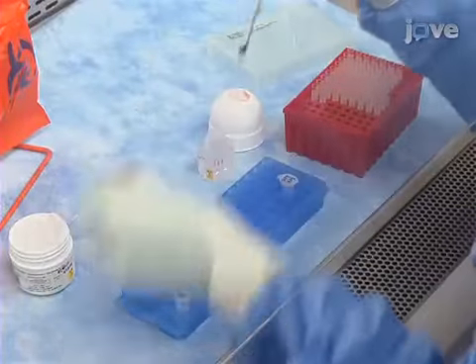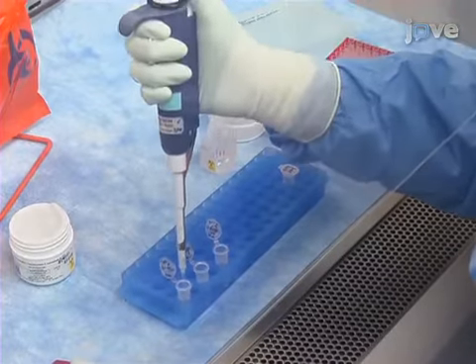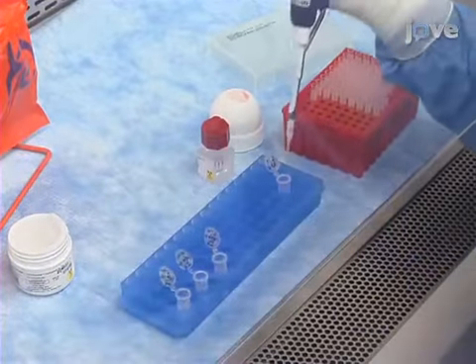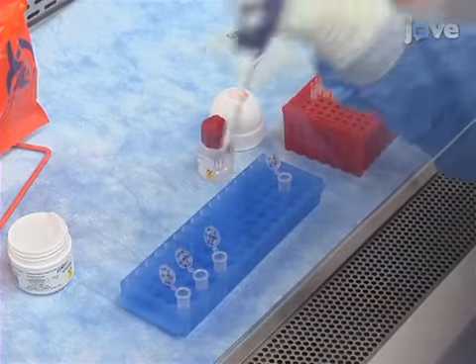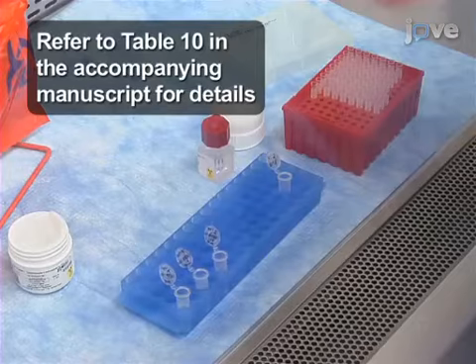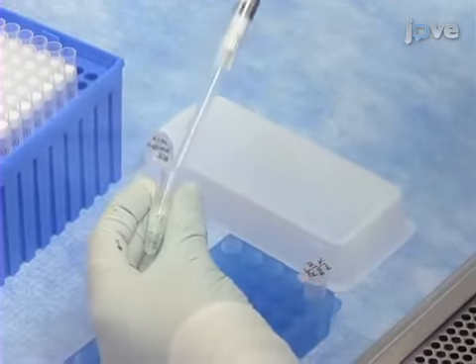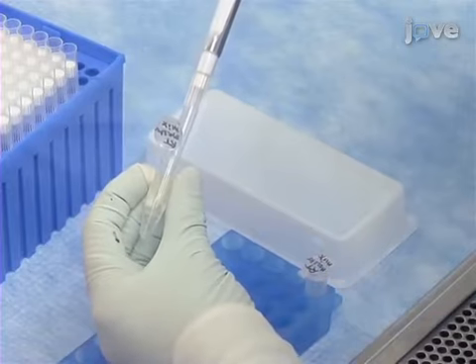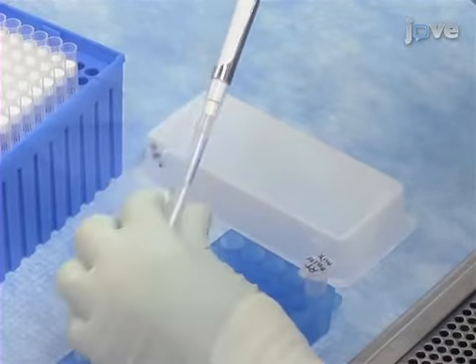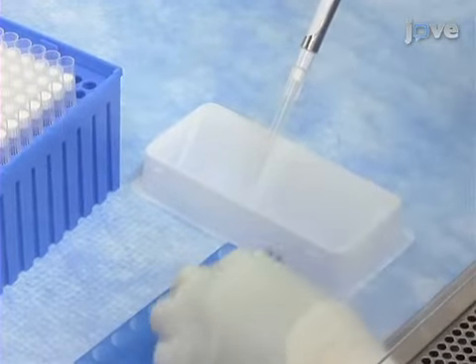In this procedure, add 1 to 2 microliters of 10 millicuries per milliliter of dTTP and 4 microliters of 1 molar dithiothreitol to each 1 milliliter aliquot of RT master mix. Carefully mix each 1.5 milliliter microcentrifuge tube of RT master mix, DTT, and dTTP with a 1000 microliter pipette and transfer to a sterile trough.